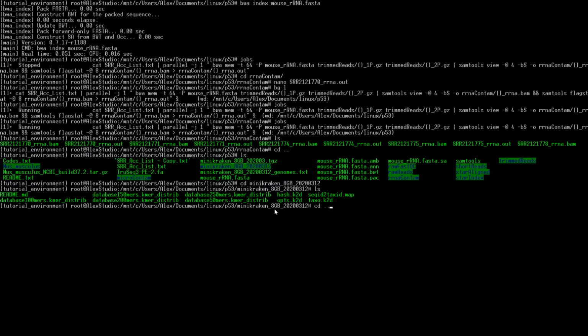So if we go back up, we can start mapping. All right. So if we just want to look at one quick, we can do kraken2 and then --db.